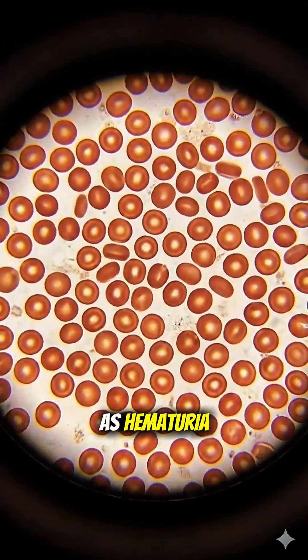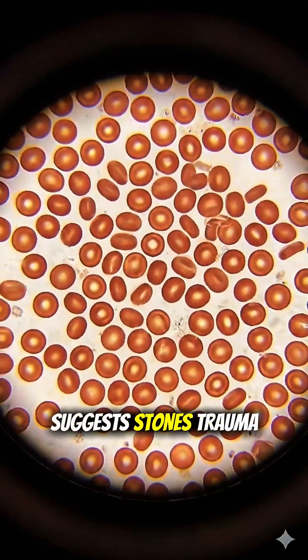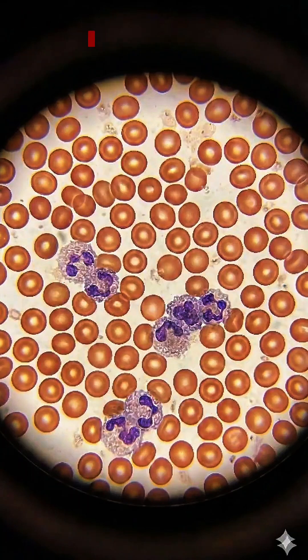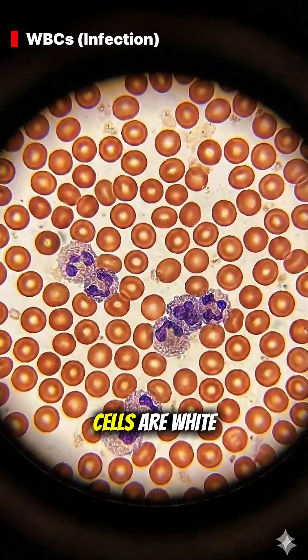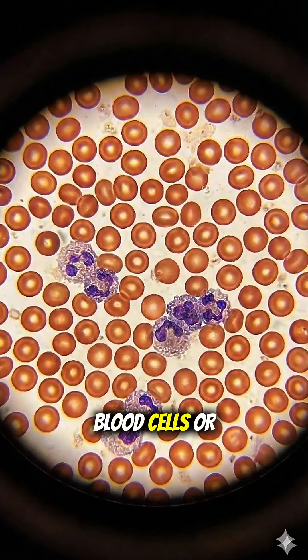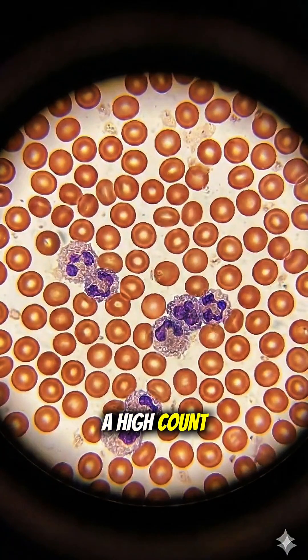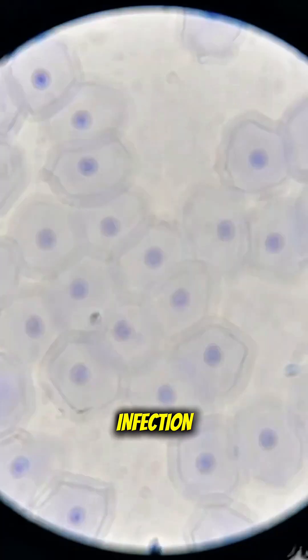Their presence, known as hematuria, suggests stones, trauma, or infection. These larger granular cells are white blood cells or pus cells. A high count here is a strong indicator of a urinary tract infection.